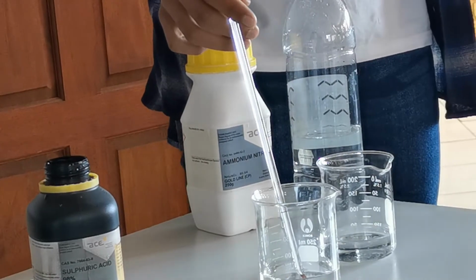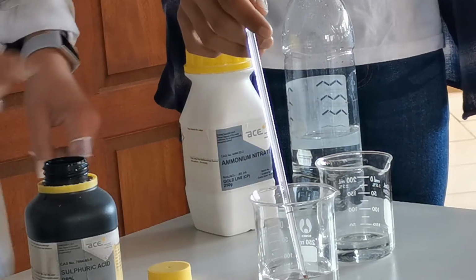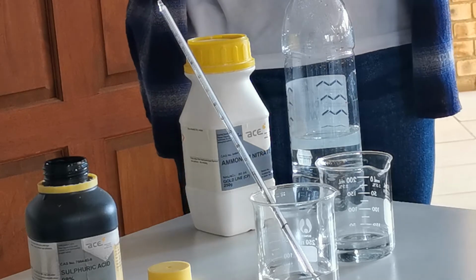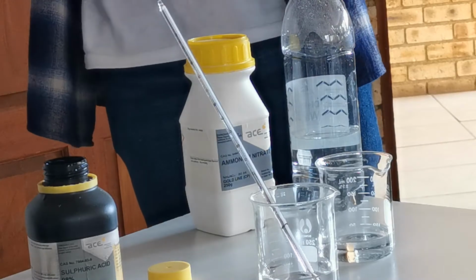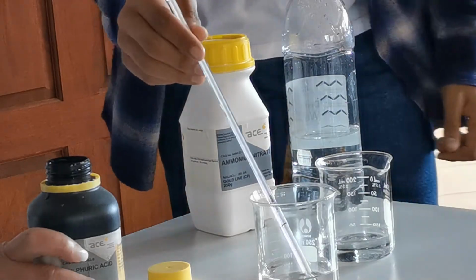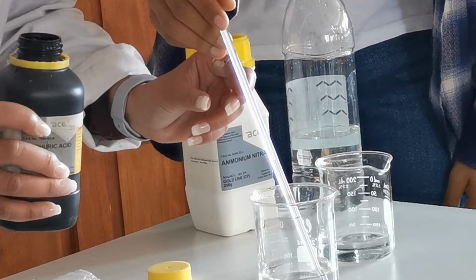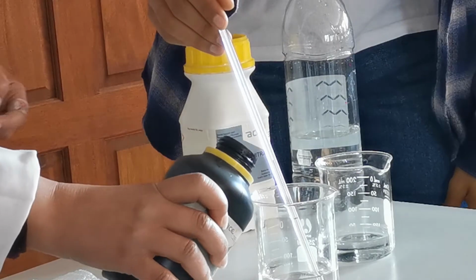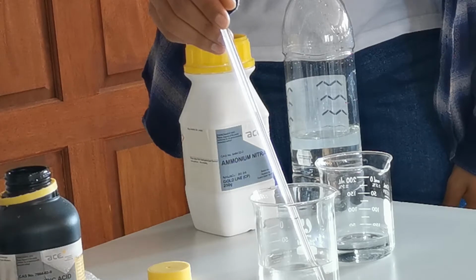Just turn that slightly. Can I get a visor? I just want to protect your eyes, that's all. Ready? So, turn this on so that the camera can see the red line. Can the camera see the red line? Okay, so the line is about there. I don't want to sit over it because it's going to give off fumes as well.